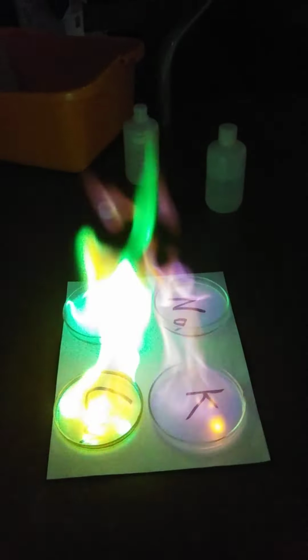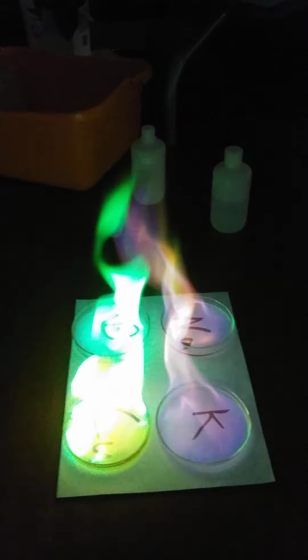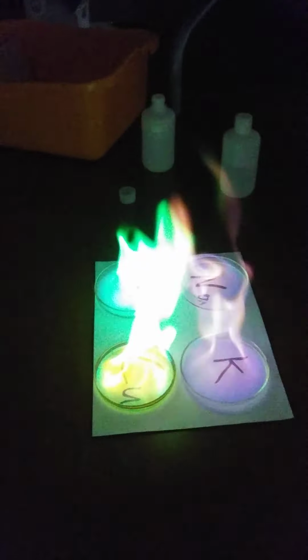Maybe you can see the different colors. A little bit. That's not great, man. I'm looking in person, of course, and on my phone, and the colors are just kind of washed out on the phone. Let's see if this, no, it's not good. Oh well, I did my best. Maybe you can see that the boron looks a little different from that angle, though.